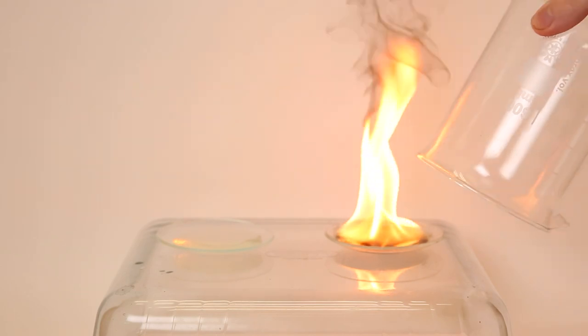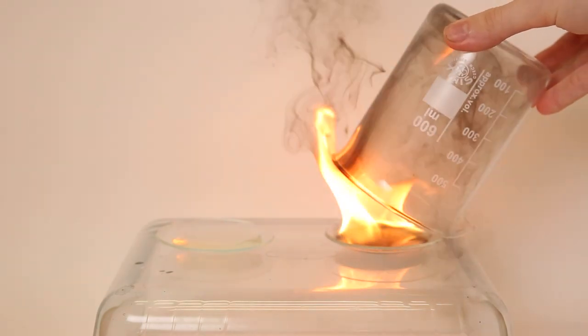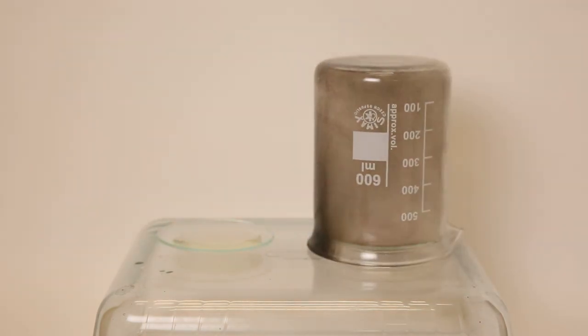I test the same with both liquids separately, and it is basically the same result. So I put out the flame early with a beaker.